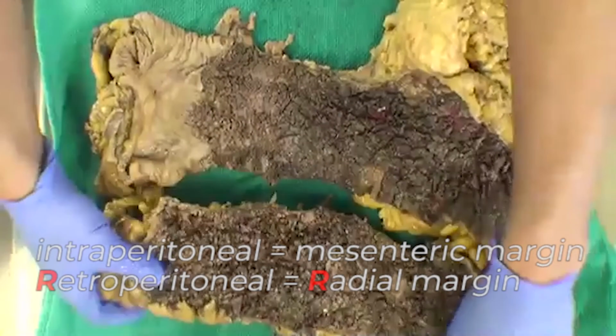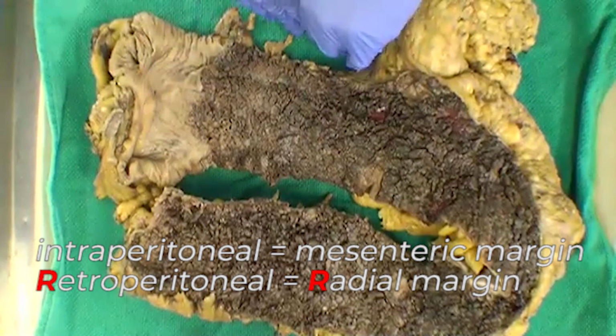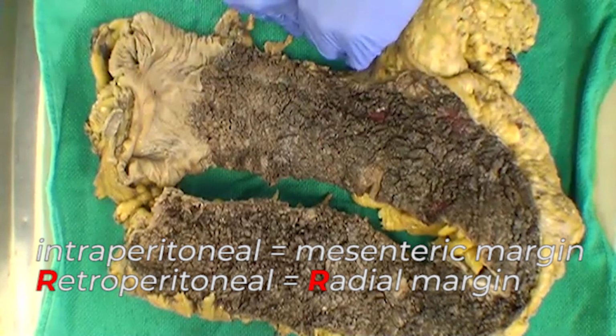Remember, if you're dealing with an intraperitoneal portion of bowel, you don't really have a true radial margin, and rather you would have a mesenteric margin where the mesentery has been cut.